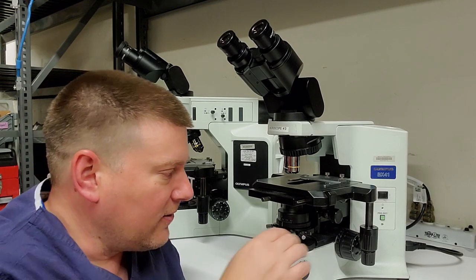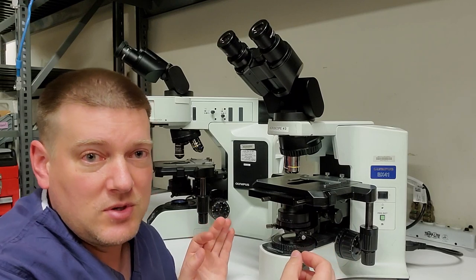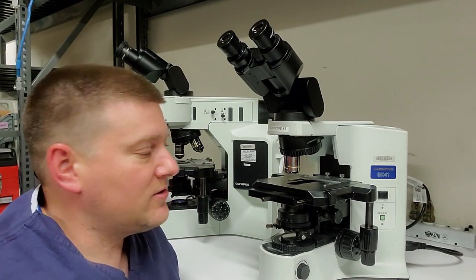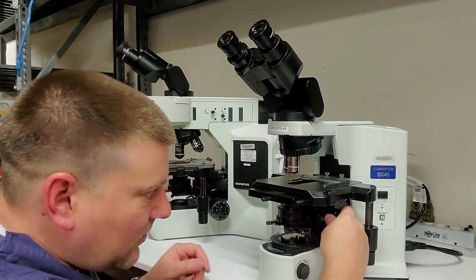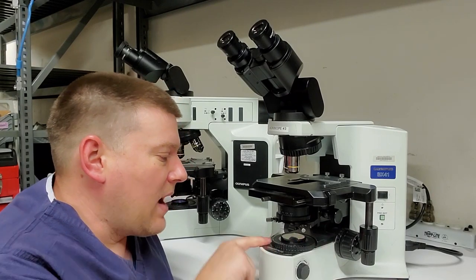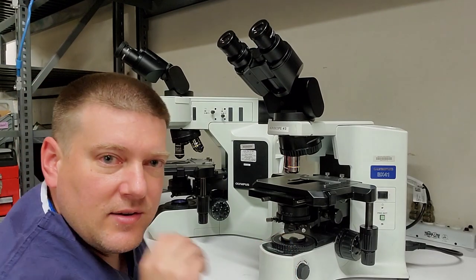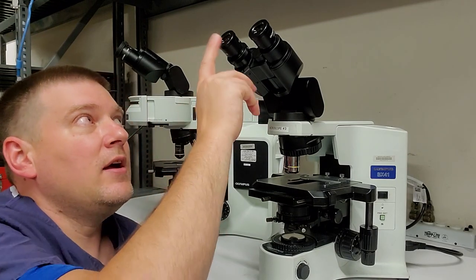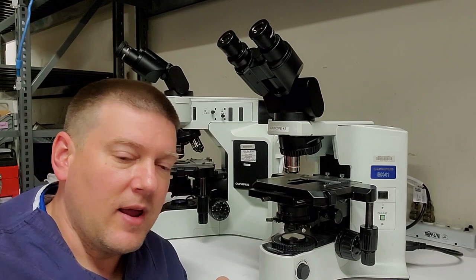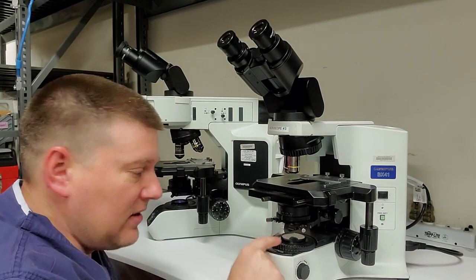I mean, you aren't going to use all of these features. Most often they leave it just wide open. But, you know, if you're looking at certain types of samples, you really want to be able to adjust every light pattern at every stage, because some things, the difference in contrast between tissues is very, very minute. So that's why we have all these crazy features on these microscopes. So right beneath your condenser is your aperture. You see this? This guy here, the aperture is all the way closed, aperture is all the way open. It's an iris, just like in your eyeball, okay? And there's always a glass, that's right there, and the glass will have different filters. It's like a coating that's on the outside of it. So that all these optics are coated with a certain type of coating, and that will allow certain light to penetrate, and it will enhance light patterns, so it will improve clarity, okay? So there's going to be different filters that you can put into these based on what you're doing.